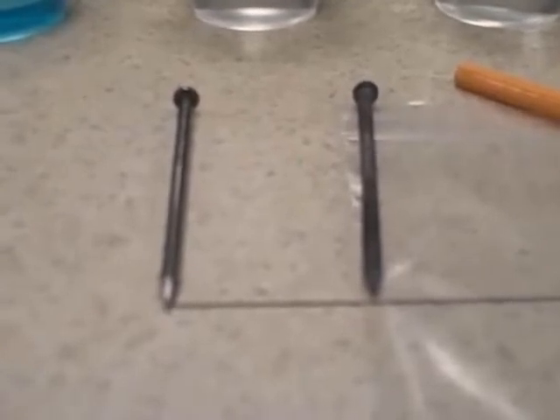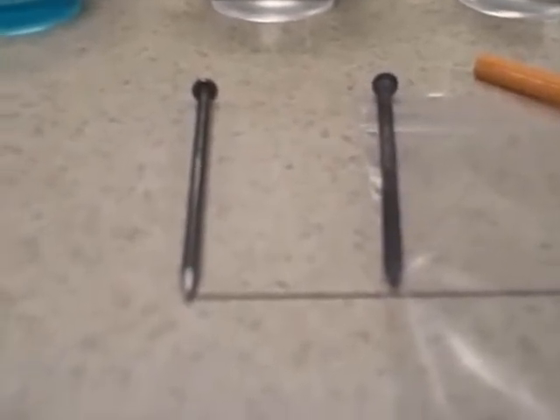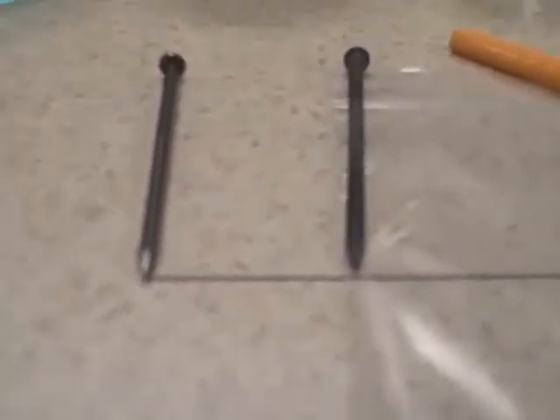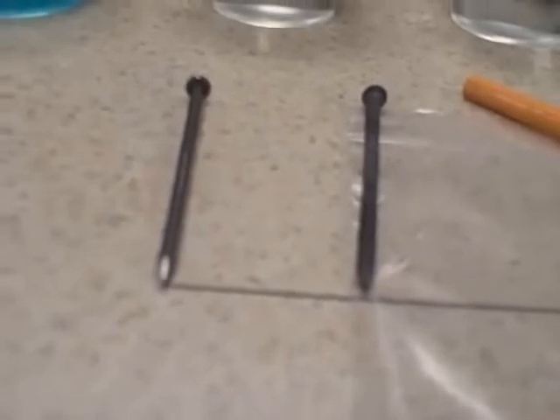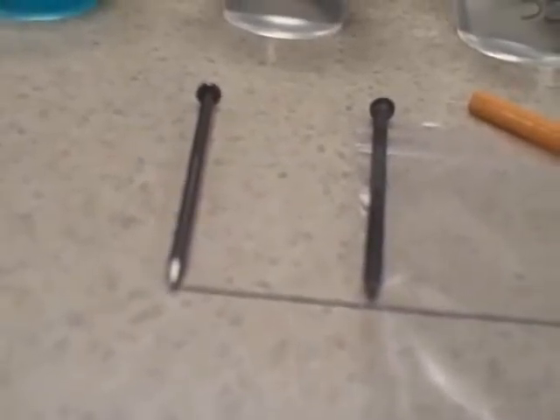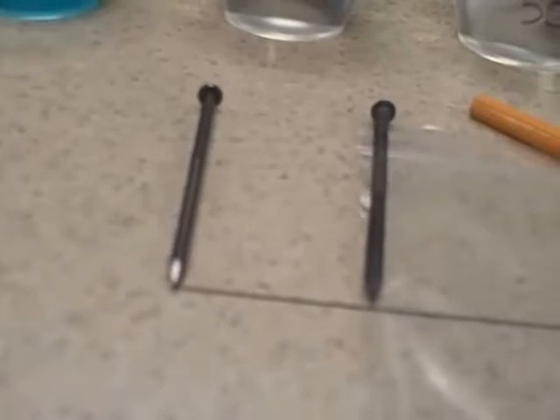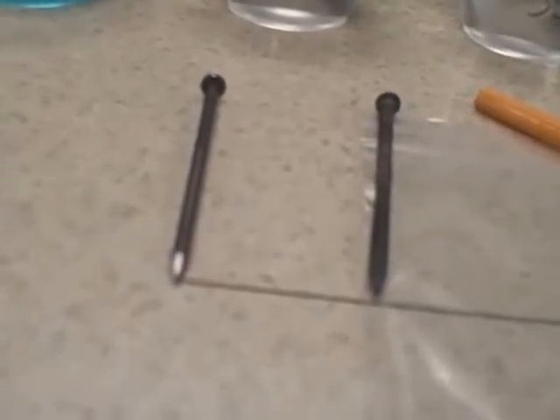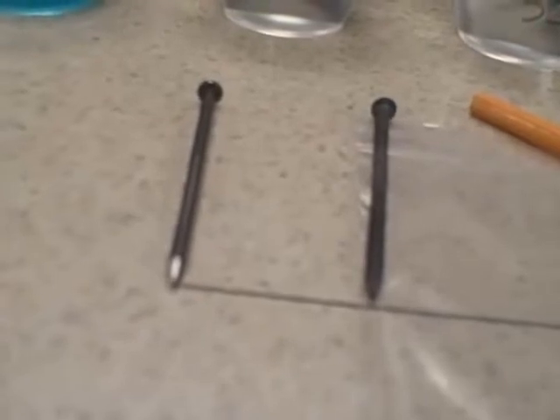This is already done, right? It's done for today, yes. For the kits, when you take your kit home, this has not been done. Right. You have to do it the night before the experiment. In the morning of the experiment, take the nails out, lay them down on a double paper towel, and then with your gloves on, rub as much of the zinc oxide coating off of those 5 nails as you can. It's messy. Expect there to be a lot of zinc oxide dust.